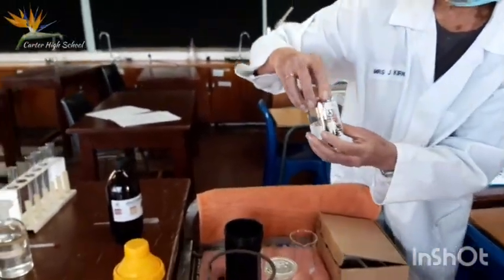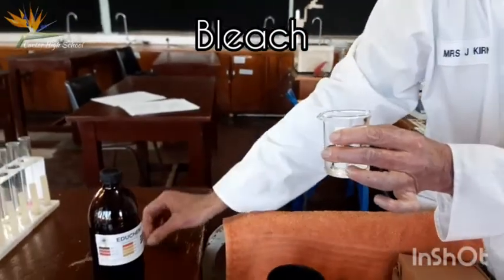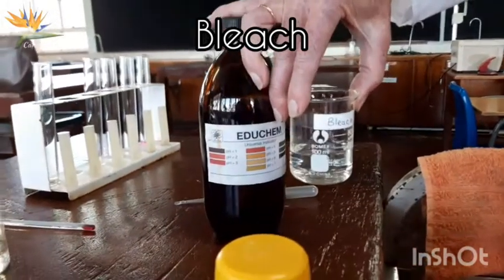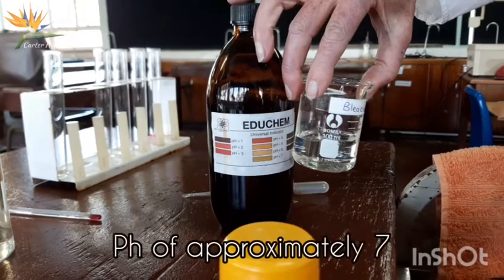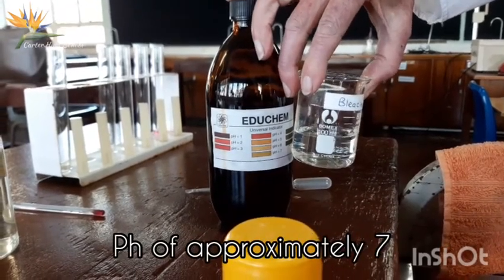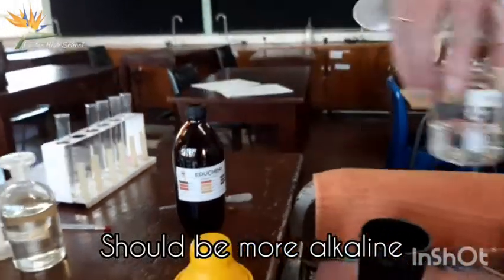Then we come to the bleach. I think there's a problem with our bleach too, because usually it's definitely very alkaline. This is also around about 7. Yeah, it's sort of a light, that sort of olivey green almost, which is about 7, but it should actually be darker than that. But it is on the alkaline side.